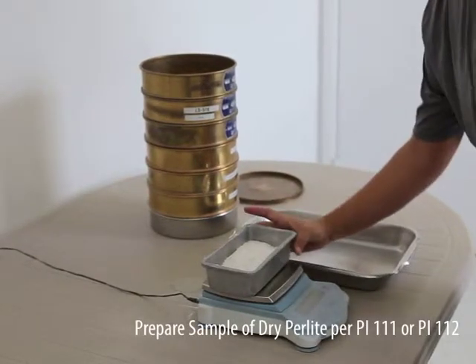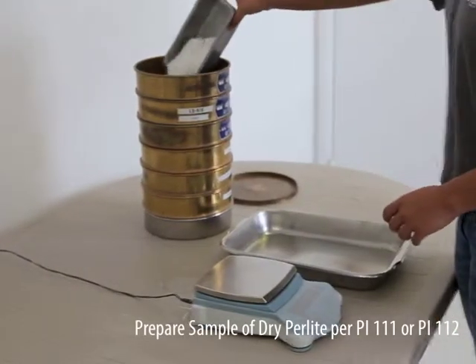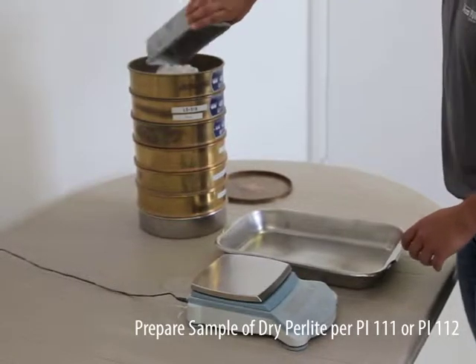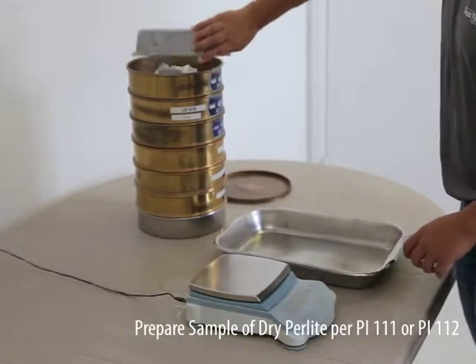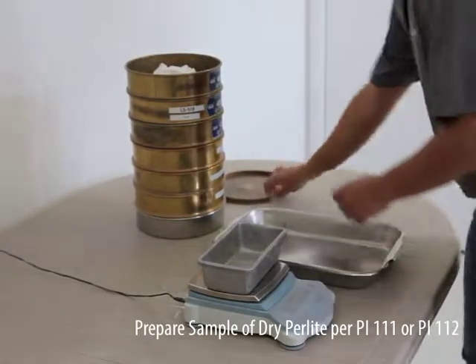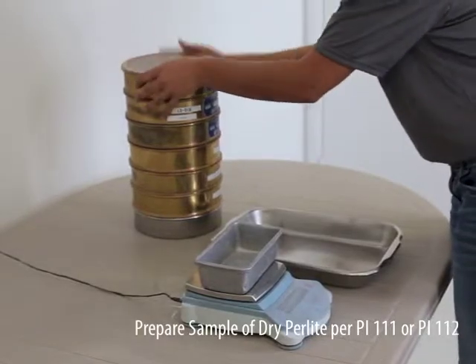Prepare a 12 to 24 ounce sample of dry perlite per PI-111 or PI-112, and then weigh the sample.